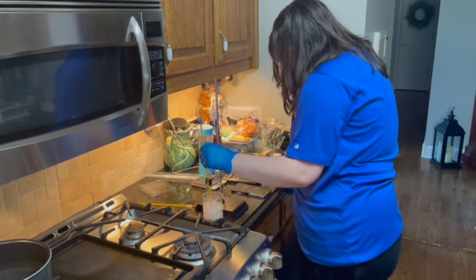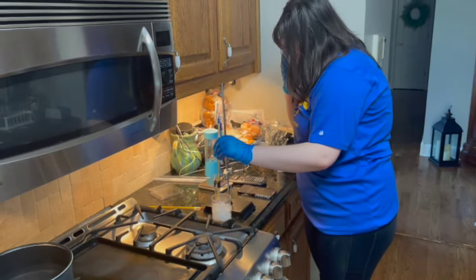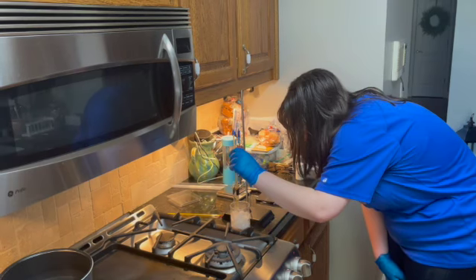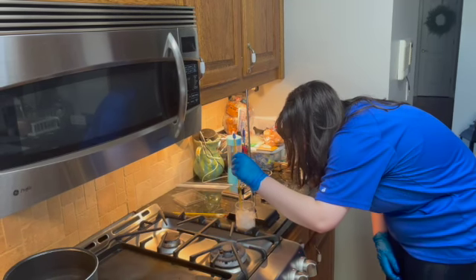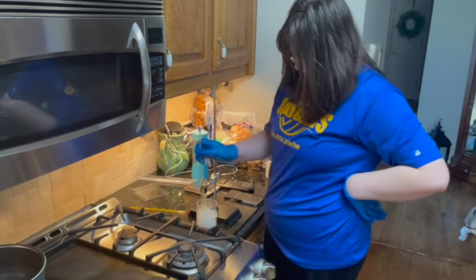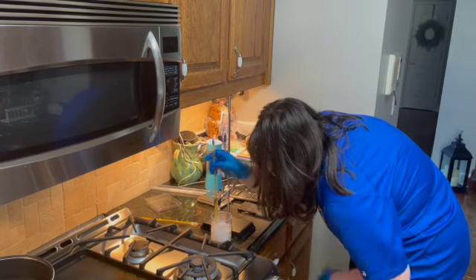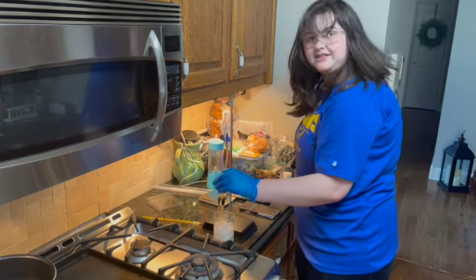And yeah, we're getting pretty close to the 4-minute mark. We're at 3 minutes and 50 seconds right now, so in 10 seconds I will state its temperature, but I can clearly tell that it is getting a lot harder. At the 4-minute mark, it is now at 43 degrees Celsius, and I can see a lot of it has hardened. Let me move the ice a little bit so I can see better. It's still pretty hard to tell if it's completely solid, but it's pretty close.